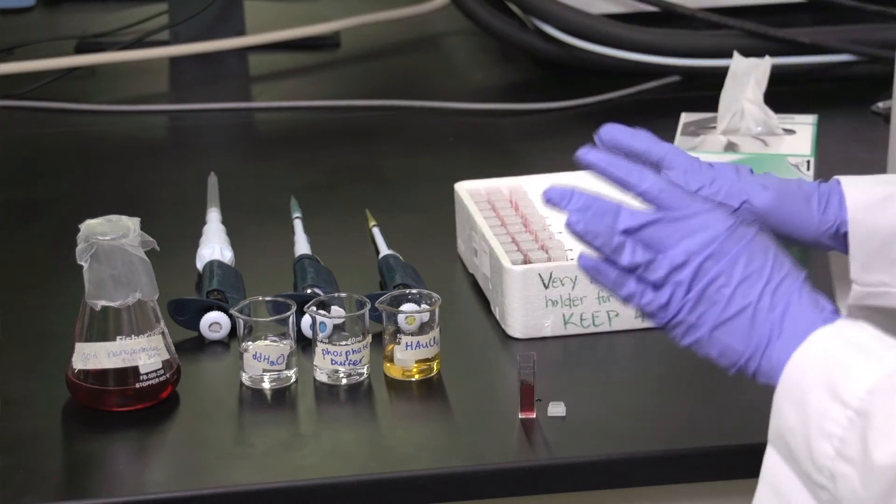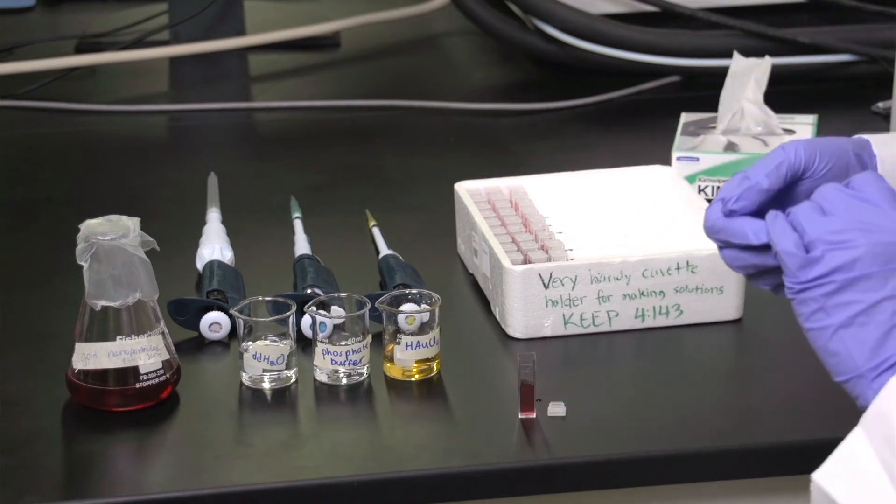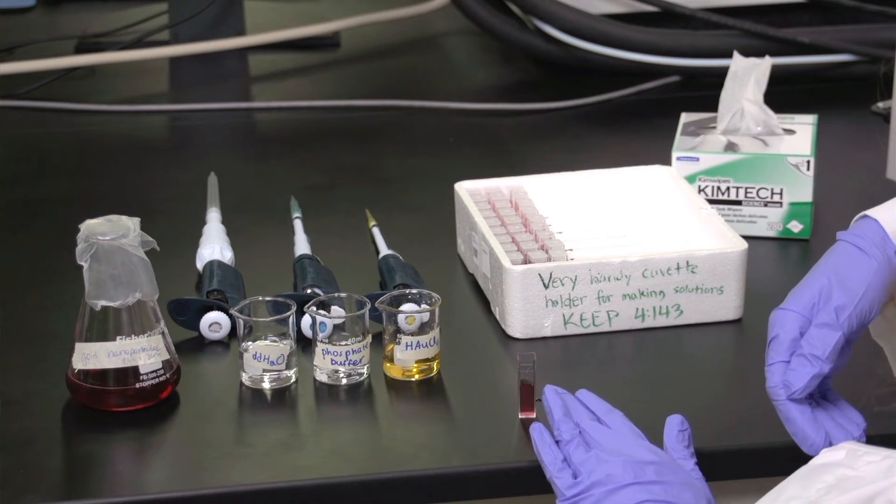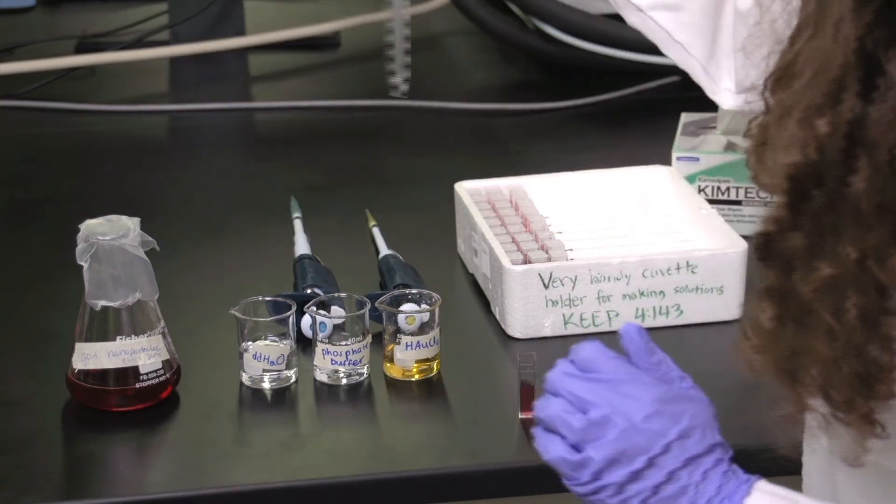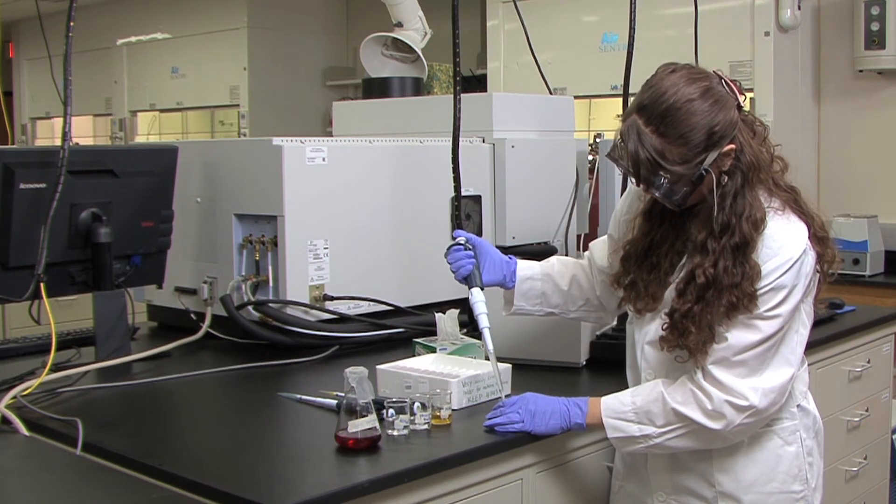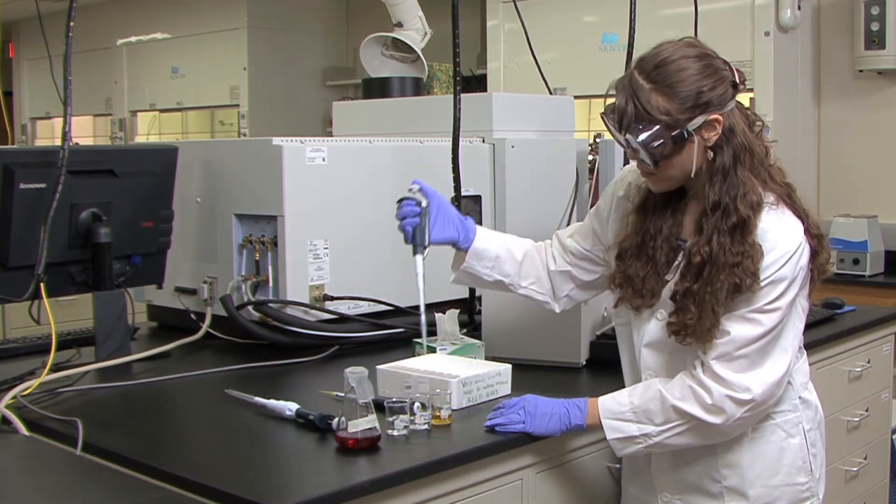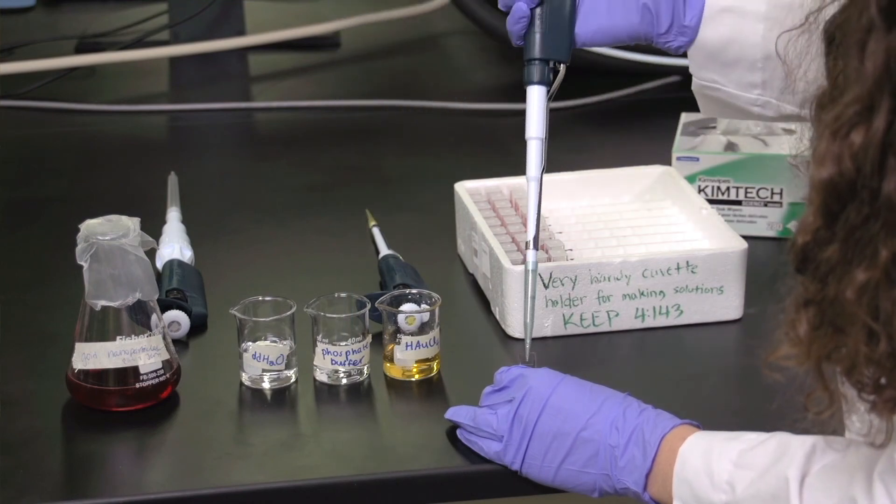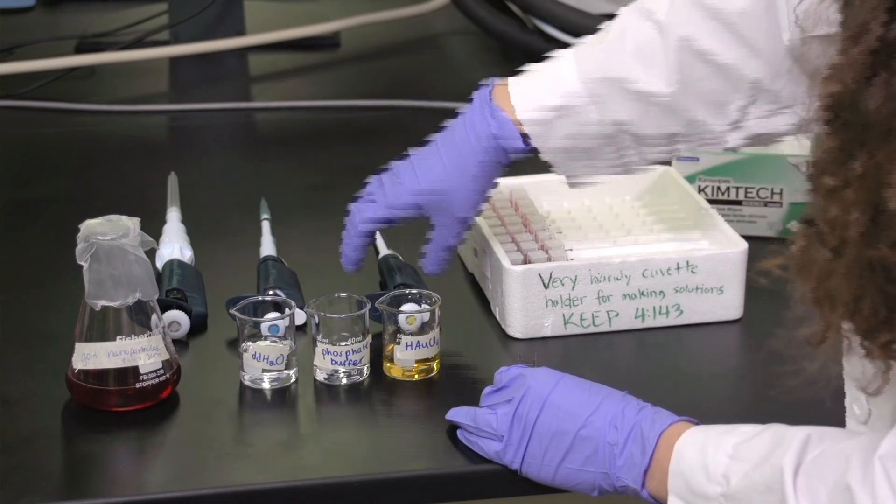It is important to note that you need to add the solutions in the exact order as they are listed in the lab manual. So to your synthesized gold nanoparticles, you first are going to add the distilled water. Next, you are going to add the phosphate buffer. And lastly, you will add the chloroauric acid.